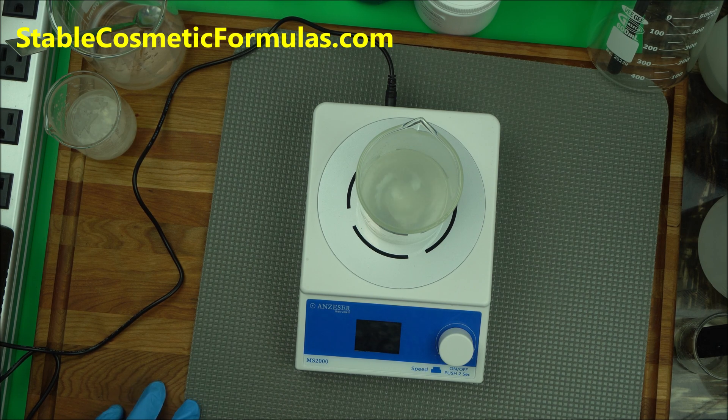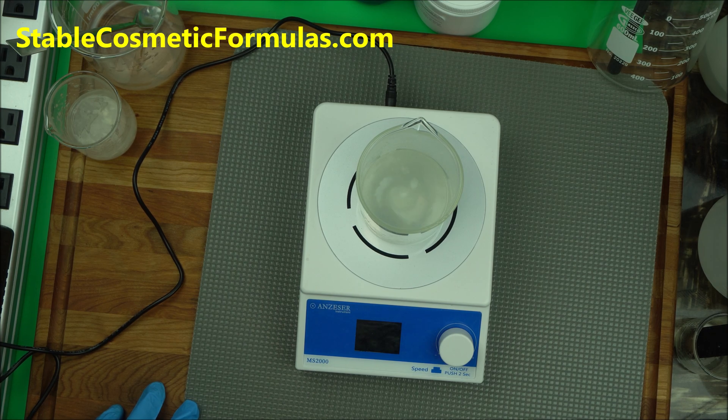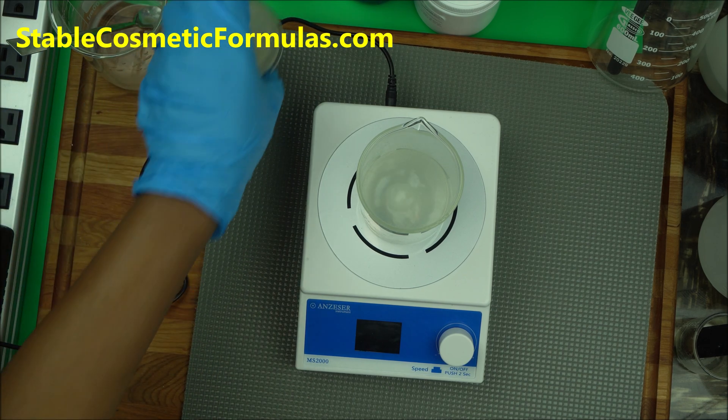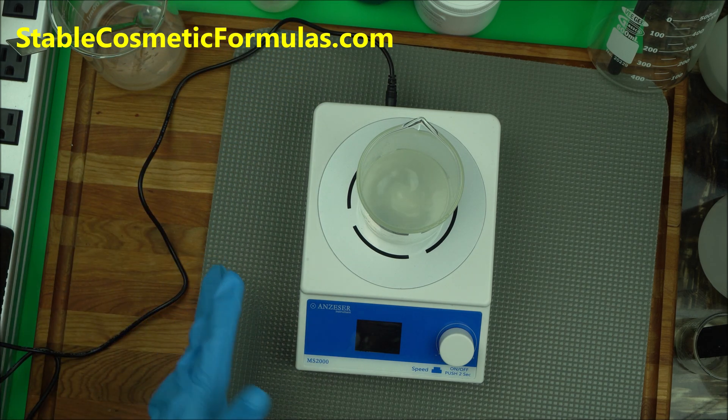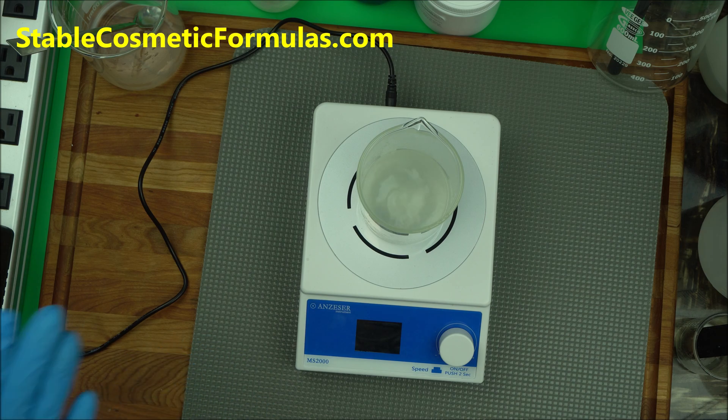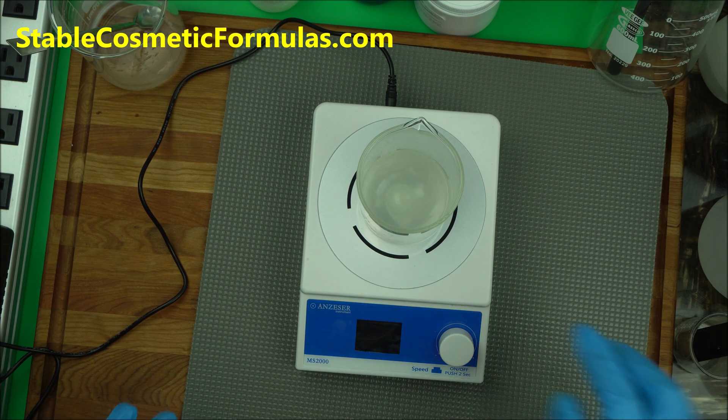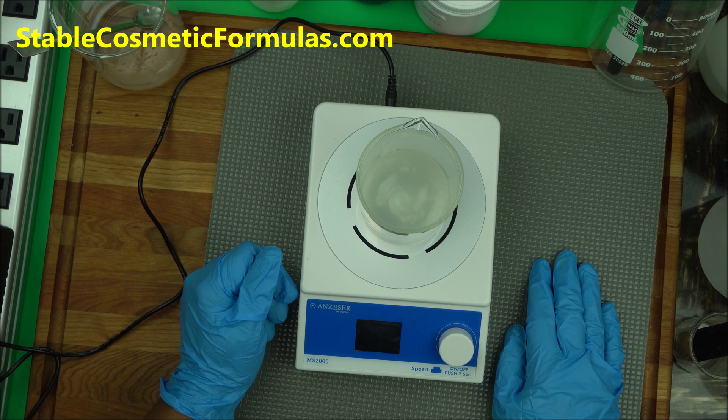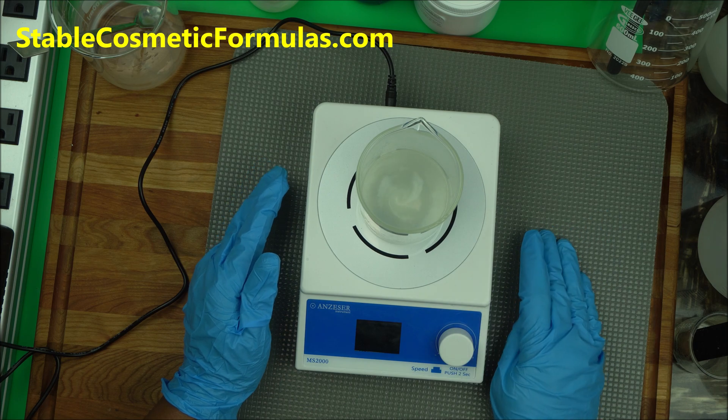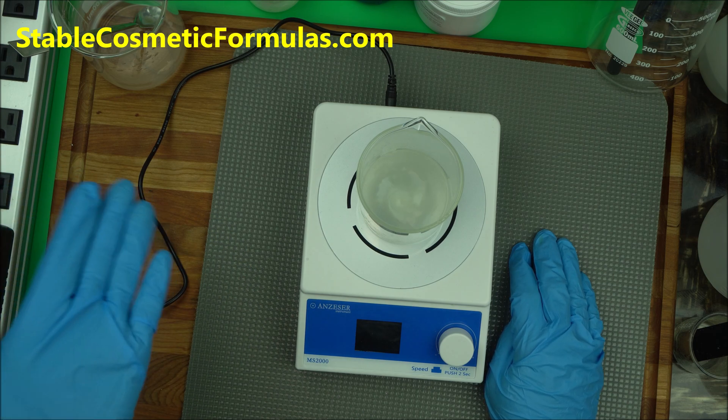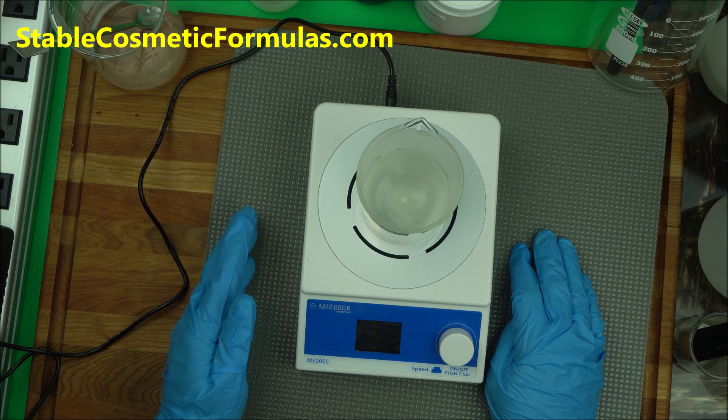The power of a magnetic stirrer is really unique. It's very important when you're blending your gum. I remember doing a video for you a moment back about tools that will make your formulation job a lot easier. Instead of me having to use my stirrer to blend this, this would do a perfect job for me. This magnetic stirrer costs around $40 here in Canada, and it's worth every bit of it.